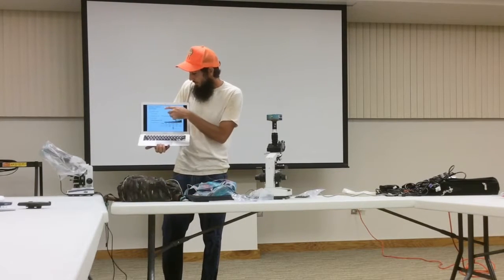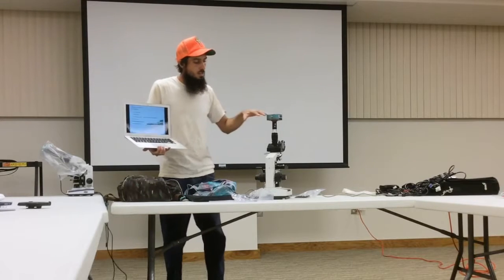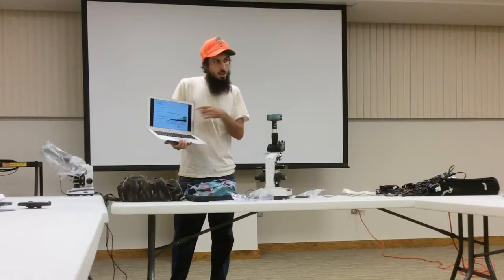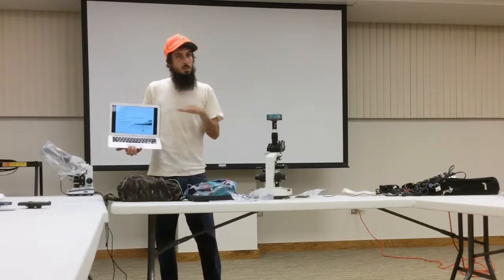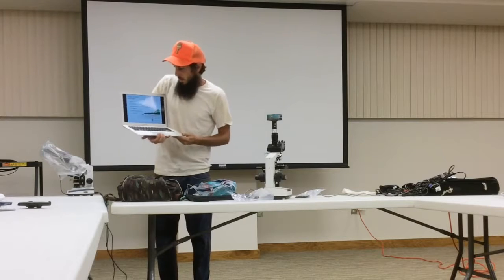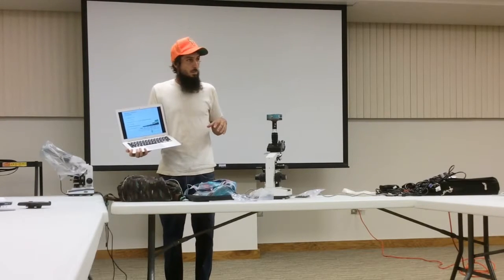And so what I have written here is what you should see on a slide if I'm in that 600 to 600, if I'm balanced with my things. And on here I have 1 nematode per slide.